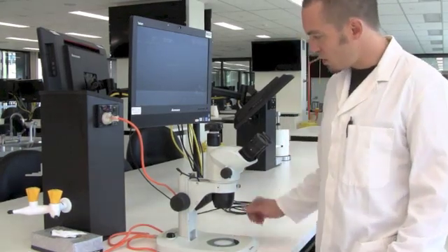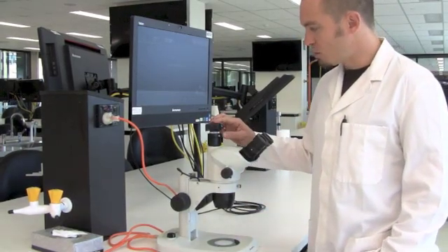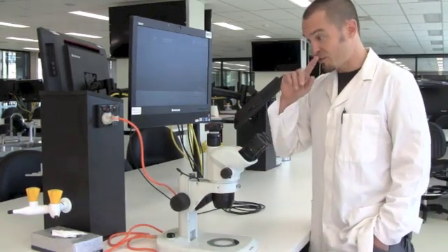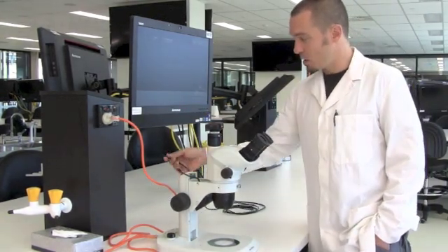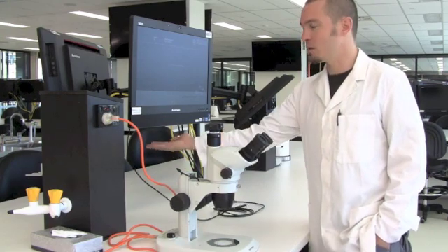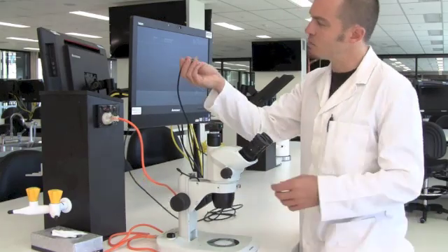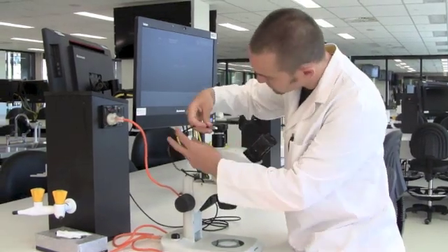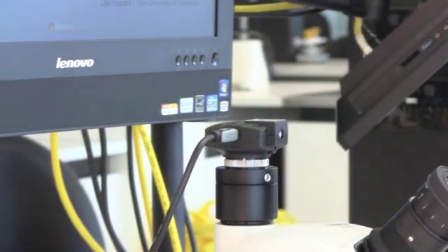The microscopes work by a tiny digital camera that can send information to the computer. It needs to be connected—we've got a computer connection here, connected to a USB 2 port at the back. All you need to do is just attach this in the side here. Carefully, and that's ready to go.